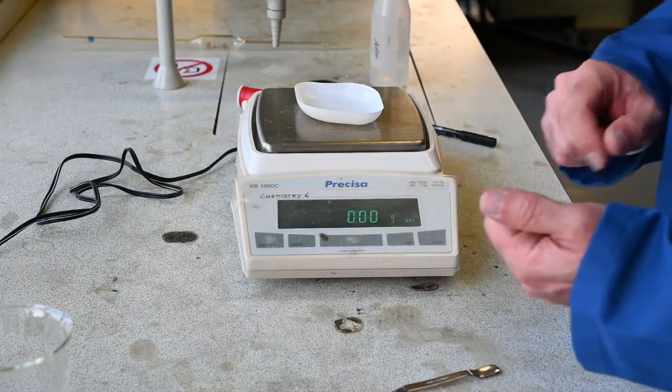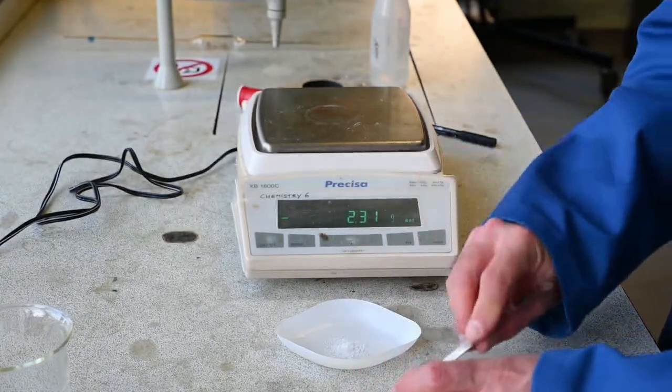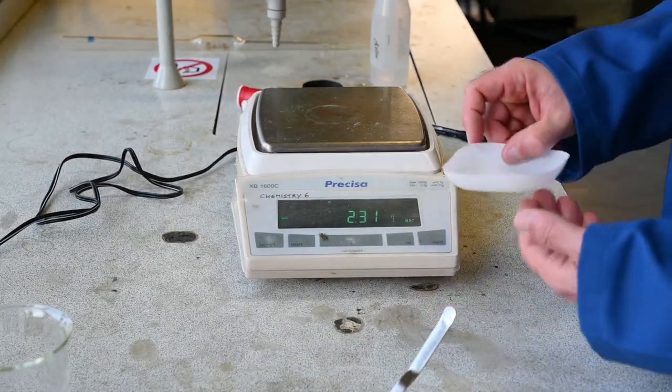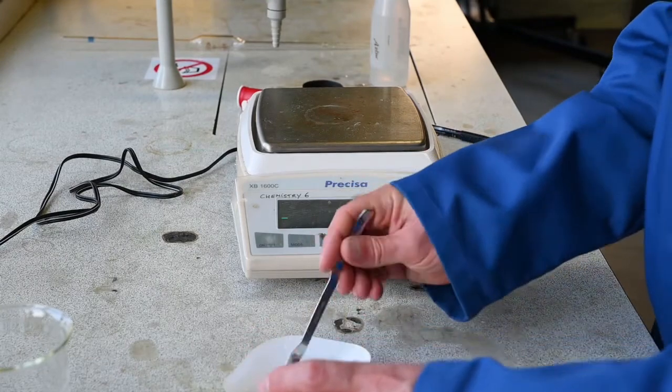I'm going to use a technique known as weighing by difference to find the mass of the ethane dioic acid. I need somewhere between about 0.7 and 0.9 grams. So I'm just going to put a weighing boat onto the balance and press T to zero the balance, then take the weighing boat off the balance and put a little bit of the solid into the weighing boat — that's about 0.4 grams, so I'll add a bit more.